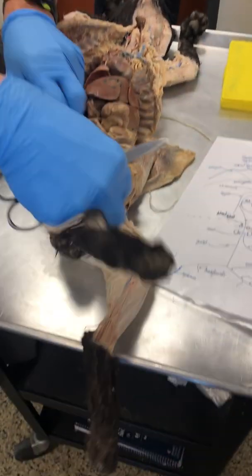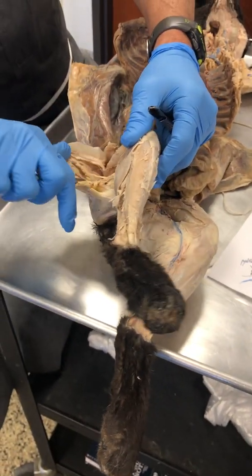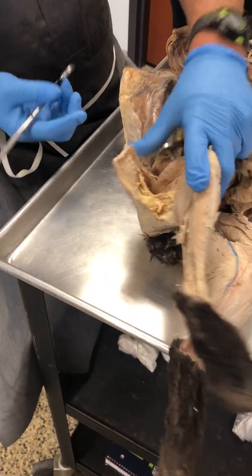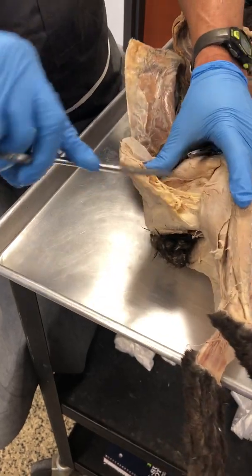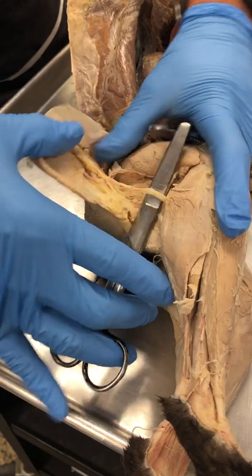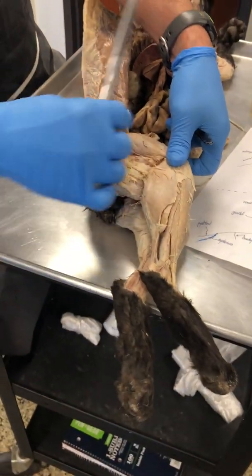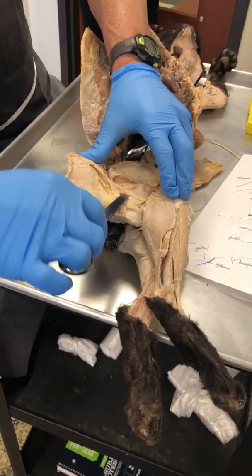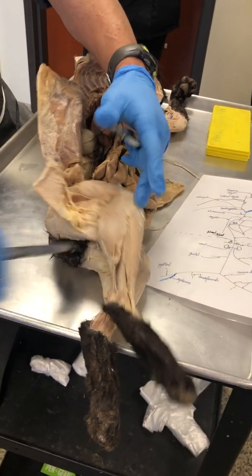And while we are here, let me just tilt around. There is the ischiatic nerve, or the sciatic nerve. There is my biceps femoris muscle, and there is the sciatic nerve right there. Whoops, sorry. It's deep to my hamstring. So they peel the hamstring away, and there is the sciatic nerve. Cool. Okay?